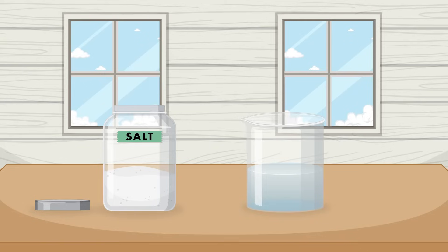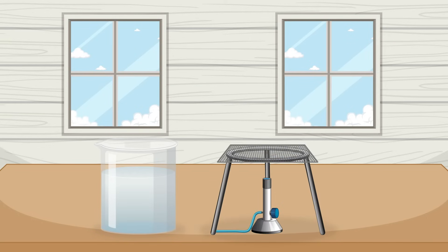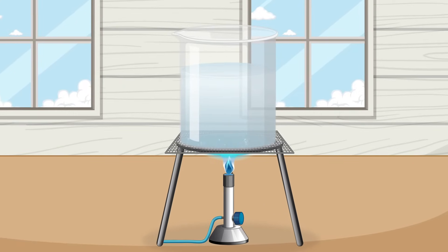Now let's look at how we can get that solid salt back out of the solution. Here we have the salt water solution in a beaker along with a ring stand with gauze and a burner. When we light the burner, it heats up the solution.